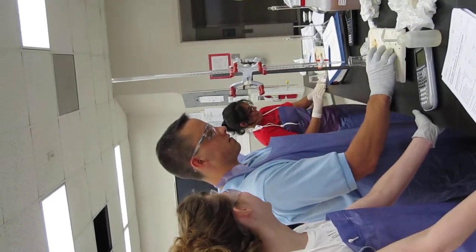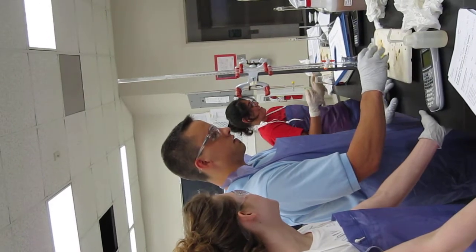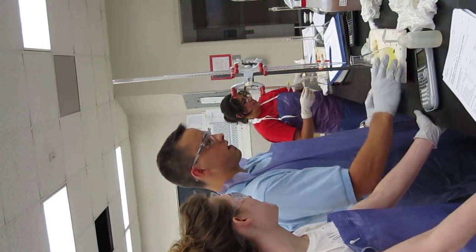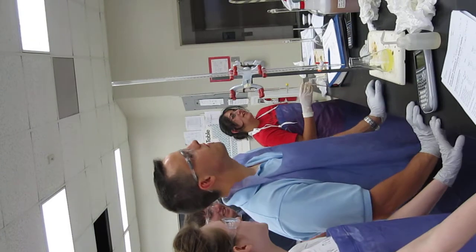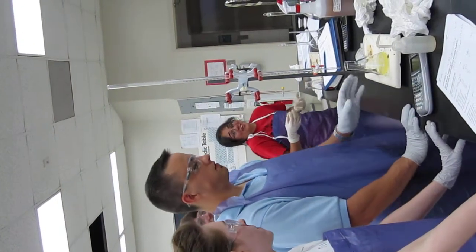Yeah, no pressure, right? But we can't see the endpoint if your hand is there. I think I should actually do it now, before I think about it.